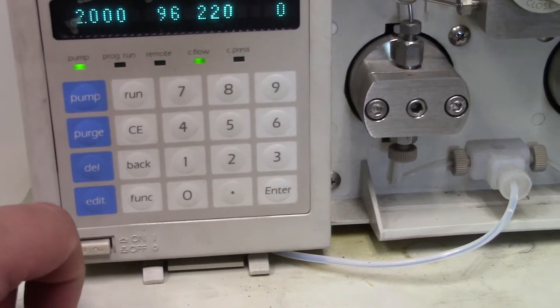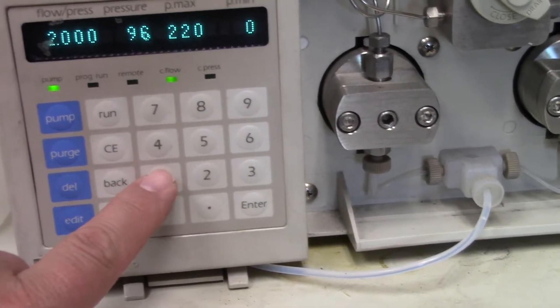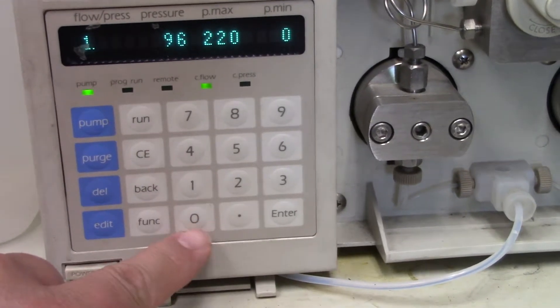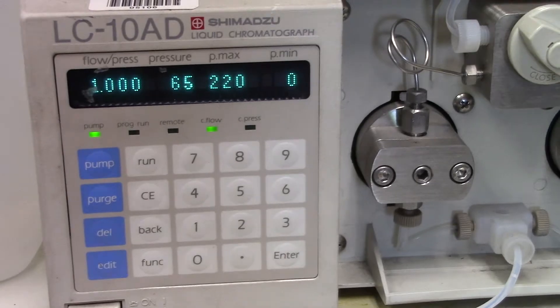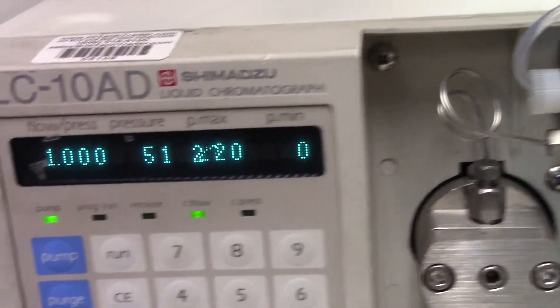P-Max. If I want to set the flow to something else. Those are decimal points, by the way. It's 1.